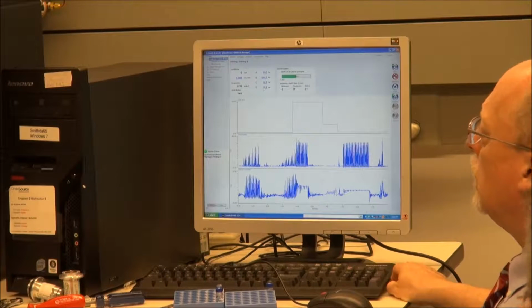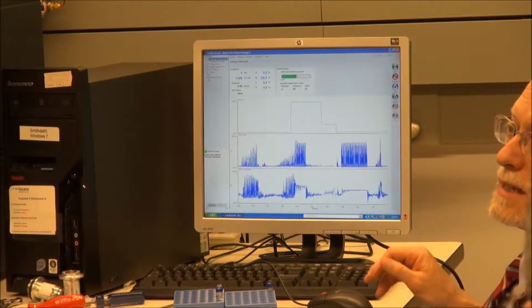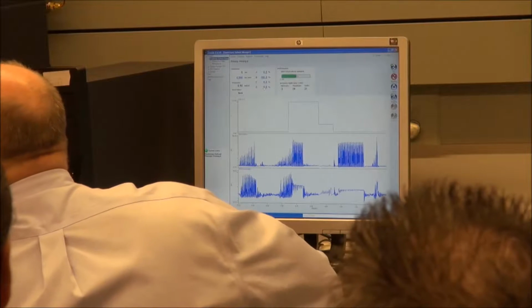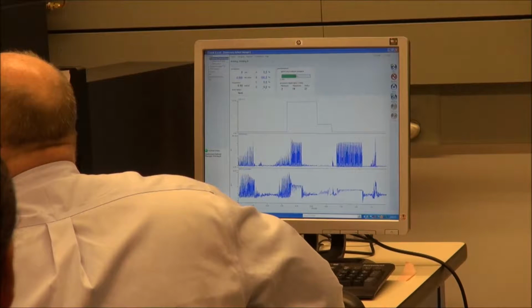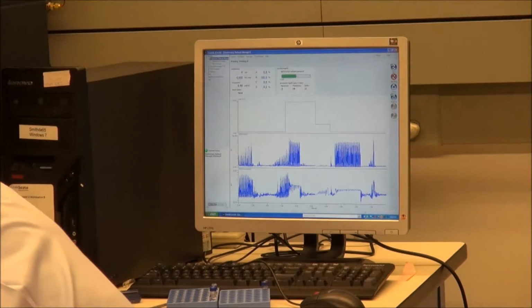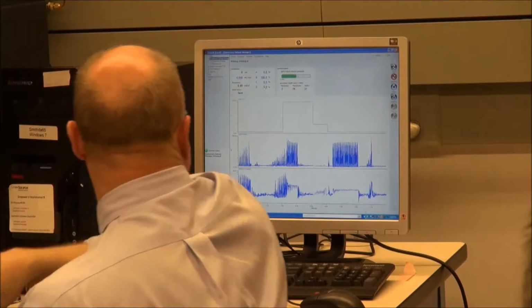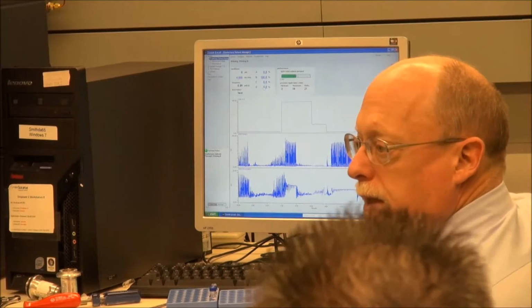I had it in the water. Well, there's tons of air in that line. So what you can do, and you have to be careful because this is ACN, is you can come up to this line. The A line is primed, the B line's not. So you can loosen it and let it start to siphon, and then tighten it back again. Whatever air is here, as soon as you open that line and let it start to siphon, you go. If that's been done like that, then we should clean up rather quickly.